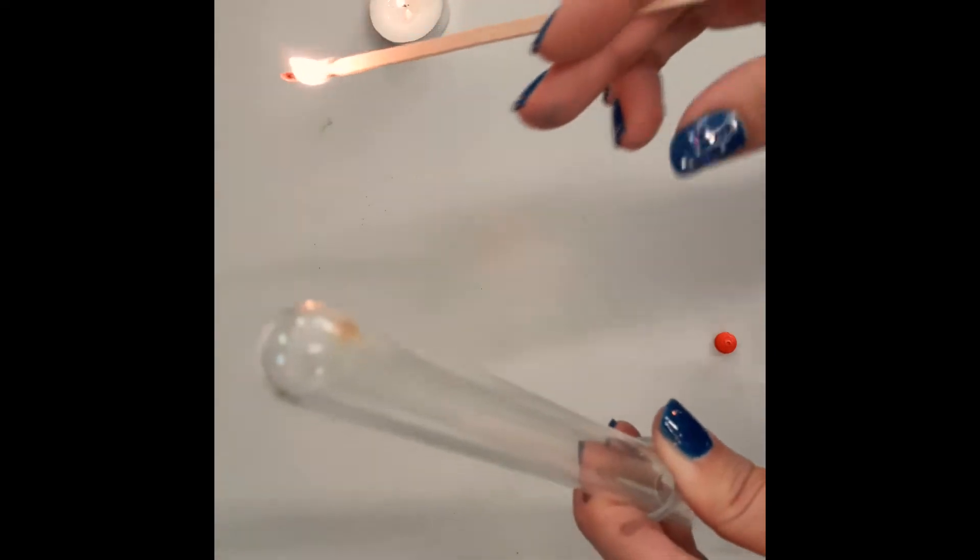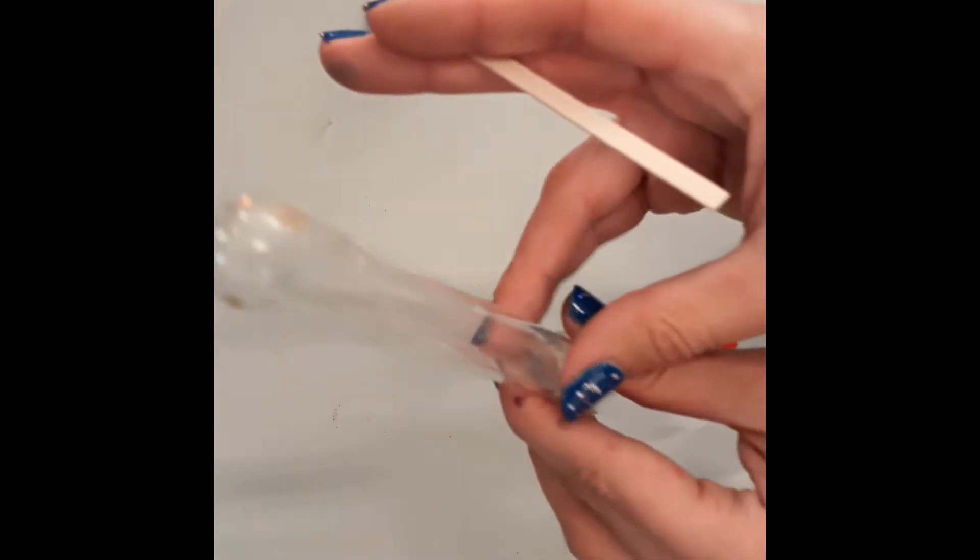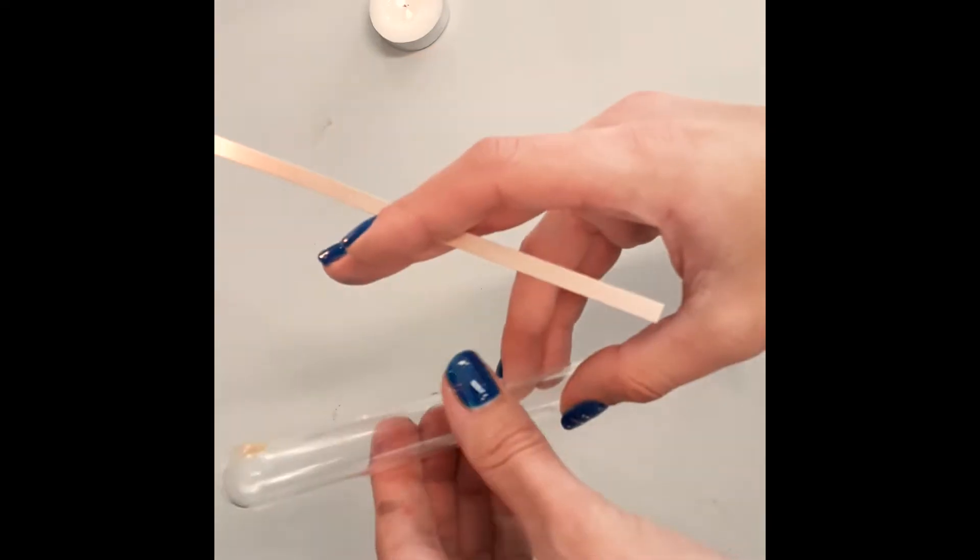So we'll see if we can get all that hydrogen gas kind of up in the top of the test tube. Here we go. Moment of truth. Oh, that was a good one. There we go.